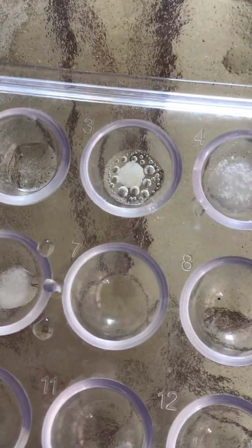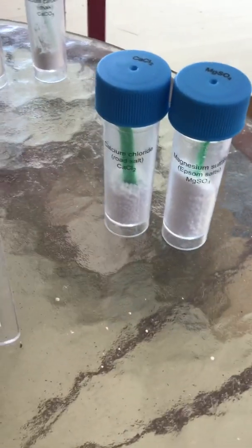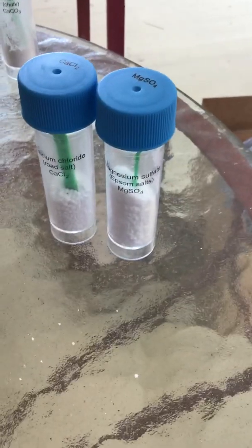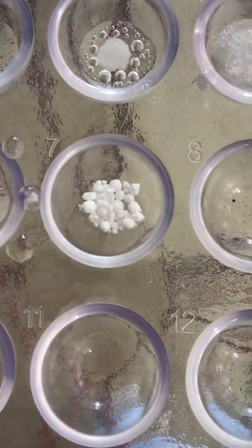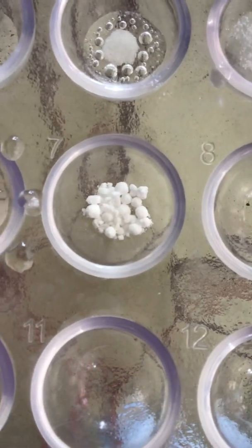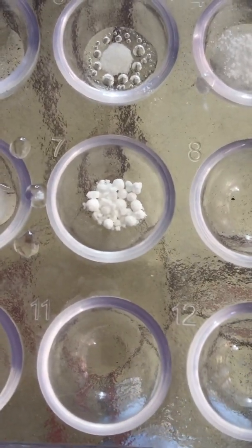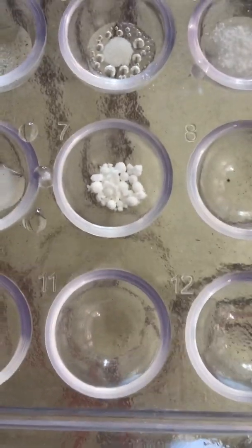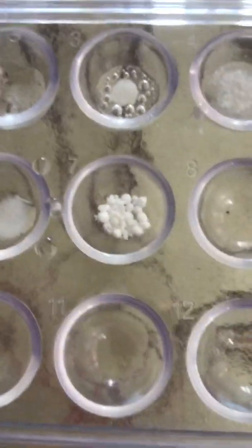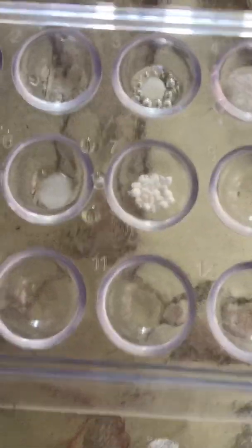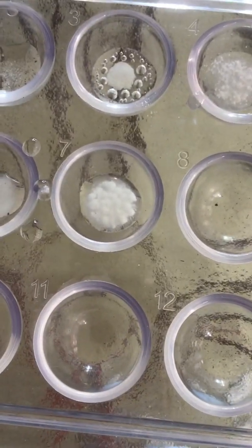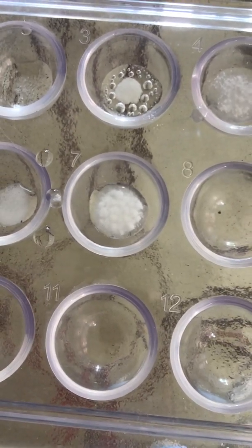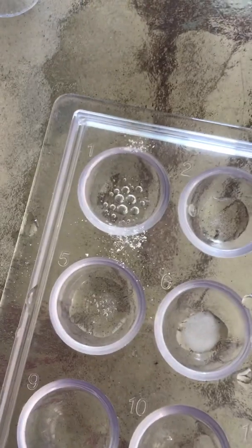Well three seems the most similar, but there's leftover residue. In well seven, I'm going to try calcium chloride and magnesium sulfate to see if there will be a reaction. They're big clumps between the road salt and the Epsom salt, which is calcium chloride and magnesium sulfate. Let's see what happens when I add water. Just getting kind of cloudy again. Still doesn't look like well one, the mystery mixture.